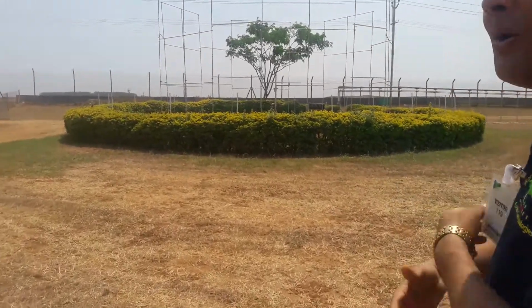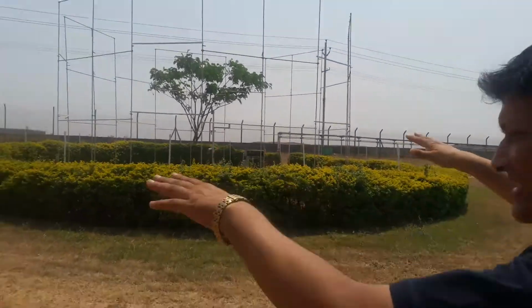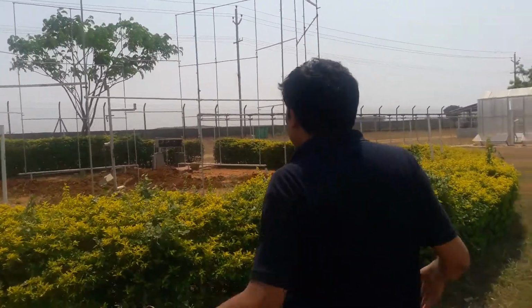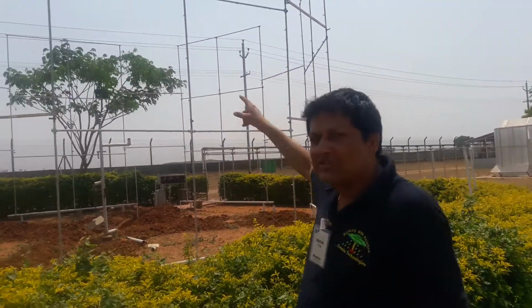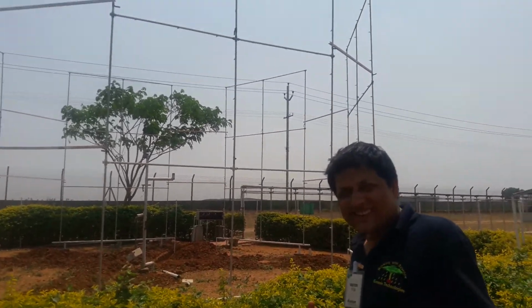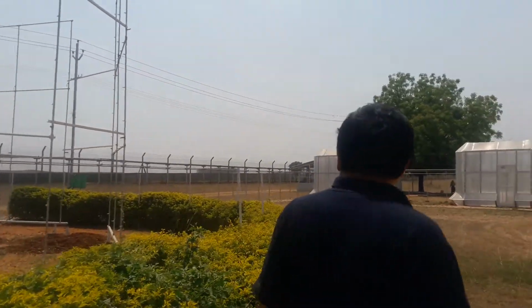This is a very complex project. This is basically an open ring, and through the open ring we are releasing CO2, right? So this CO2 is being released inside the chamber. Each arm requires CO2, and CO2 purging takes place. Again, a very complex system.